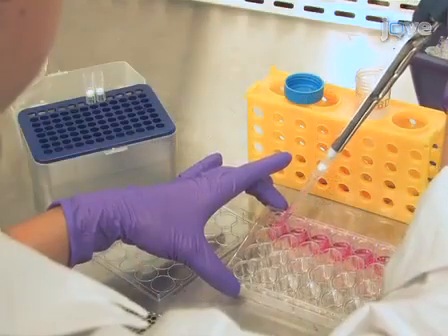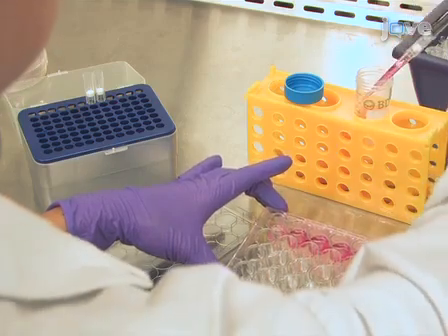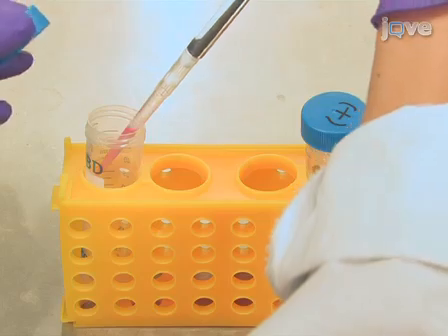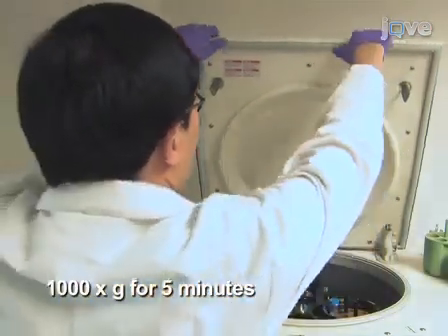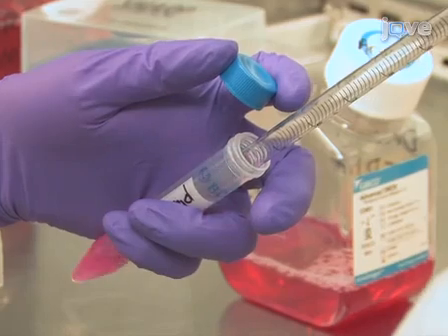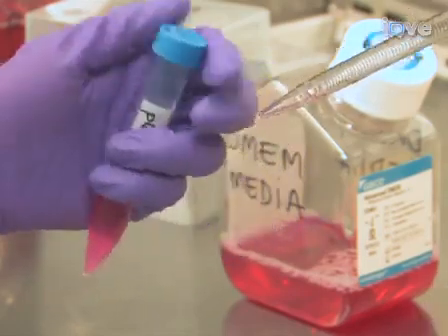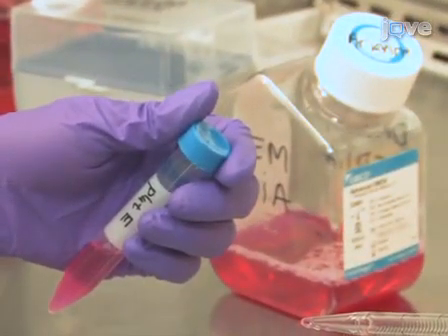Collect activated T cells from the plate into a 50 milliliter conical tube. Determine the cell number. Save some cells in a separate tube to be used as a negative control. Centrifuge at 1000 times G for 5 minutes and discard the supernatant. Then, resuspend the cell pellet in virus supernatant at 10 to the 6 cells per milliliter with 20 nanograms per milliliter of recombinant human interleukin-2 and 10 micrograms per milliliter of protamine sulfate.